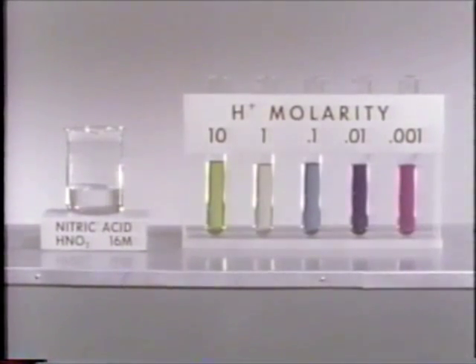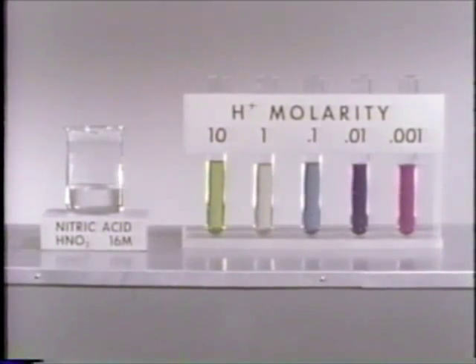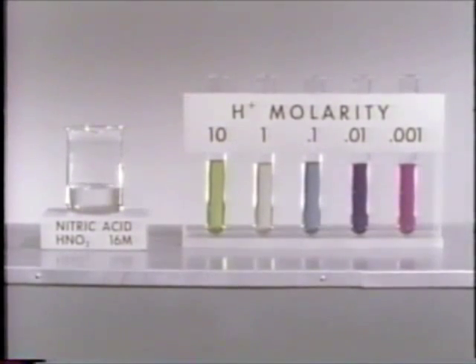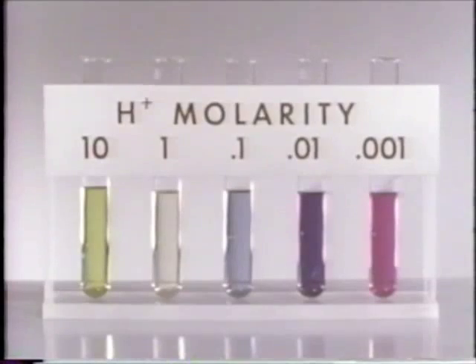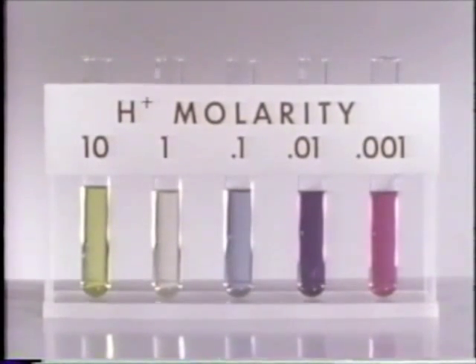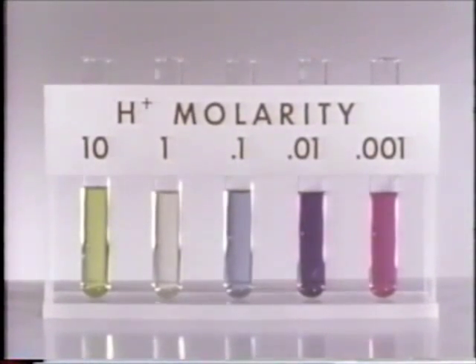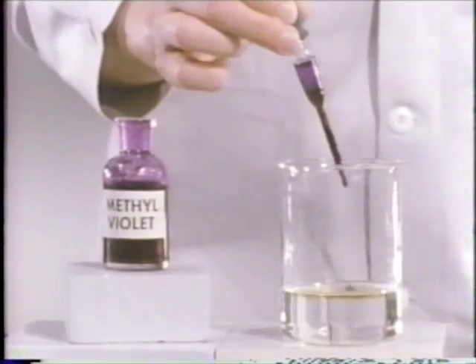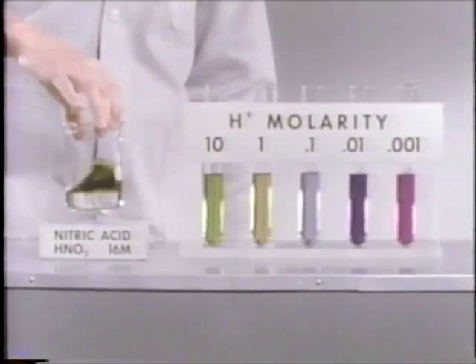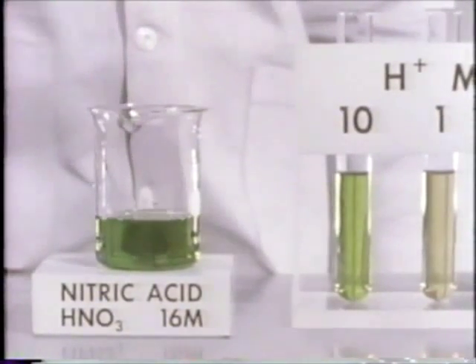Let's investigate this acidity using an acid-base indicator. Here we have a set of tubes containing solutions of varying acidity, each containing methyl violet as an indicator. Note that the color varies from green to violet as the hydrogen ion concentration changes from 10 molar to 1/1000th molar. When methyl violet is placed in 16 molar nitric acid, the color indicates a very high hydrogen ion concentration, at least 10 molar.